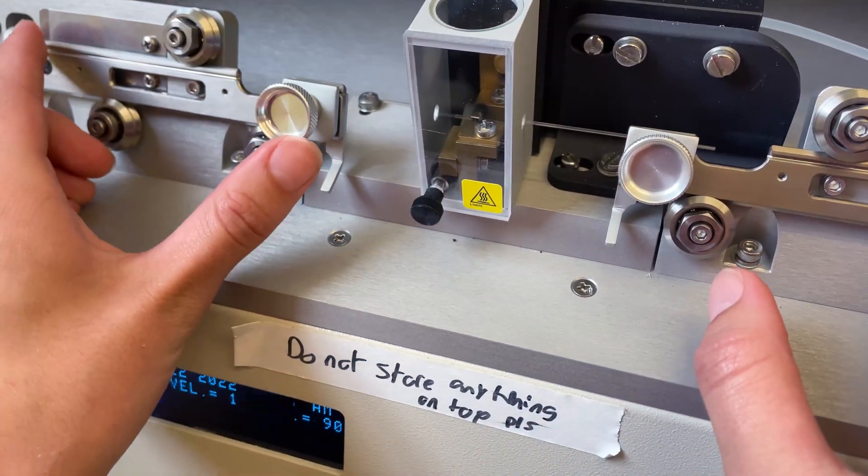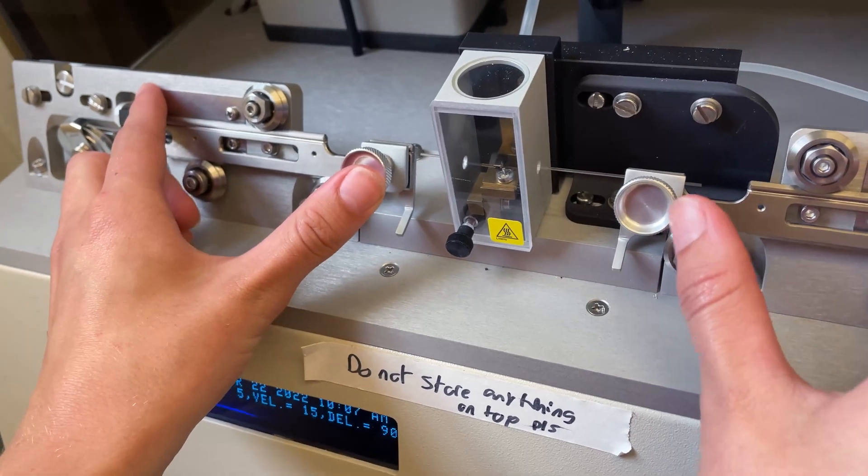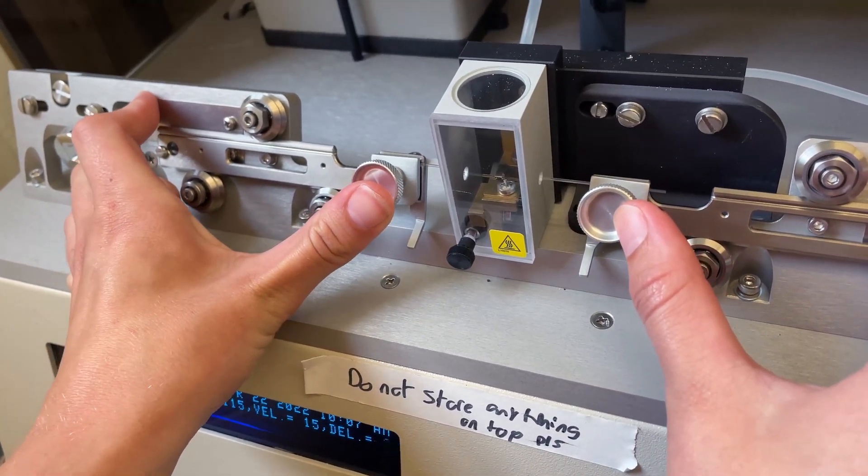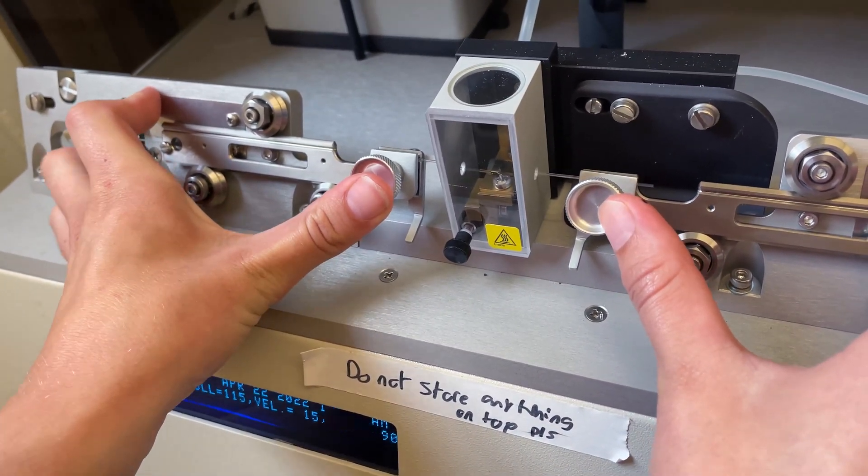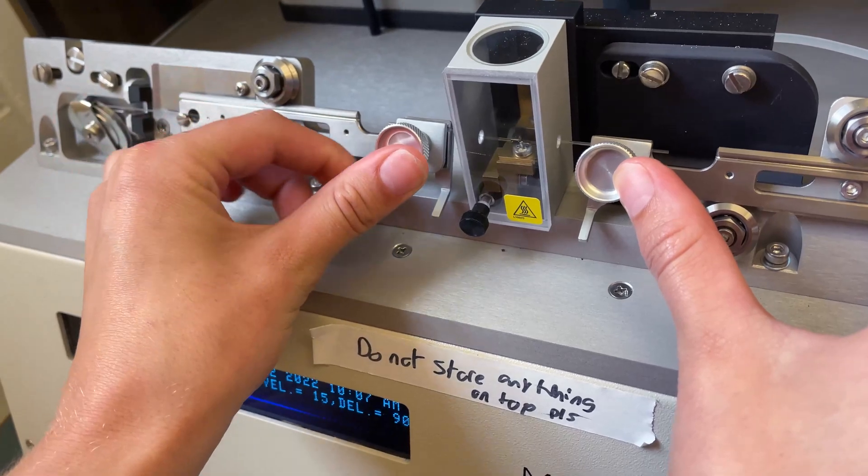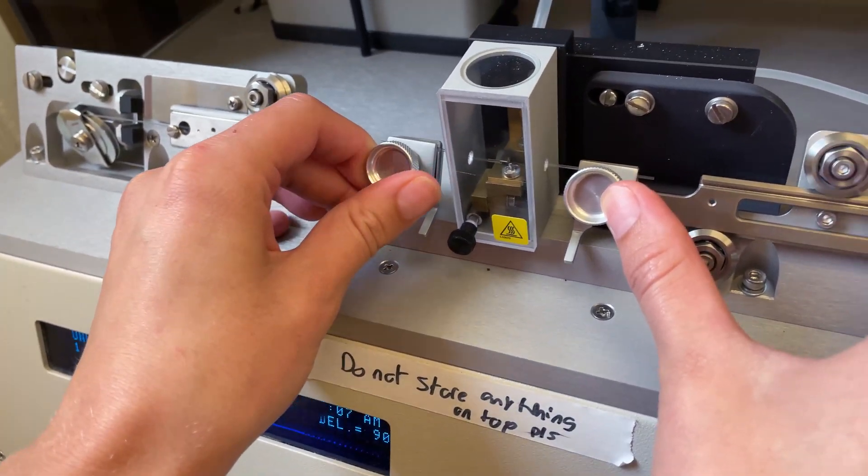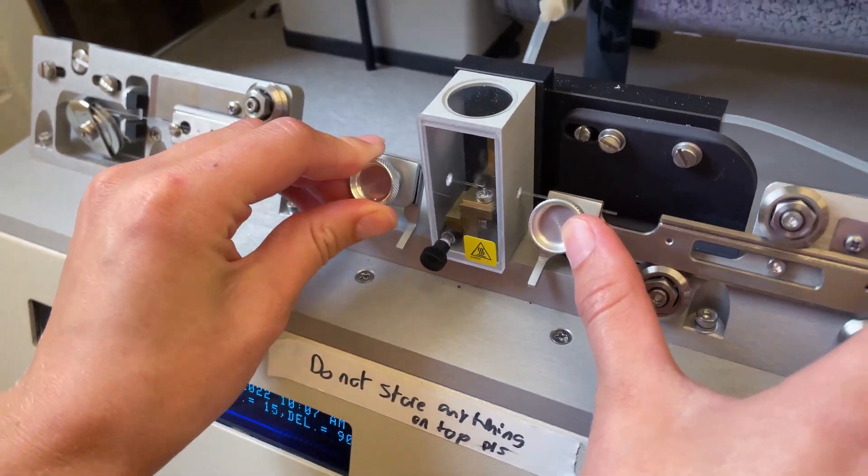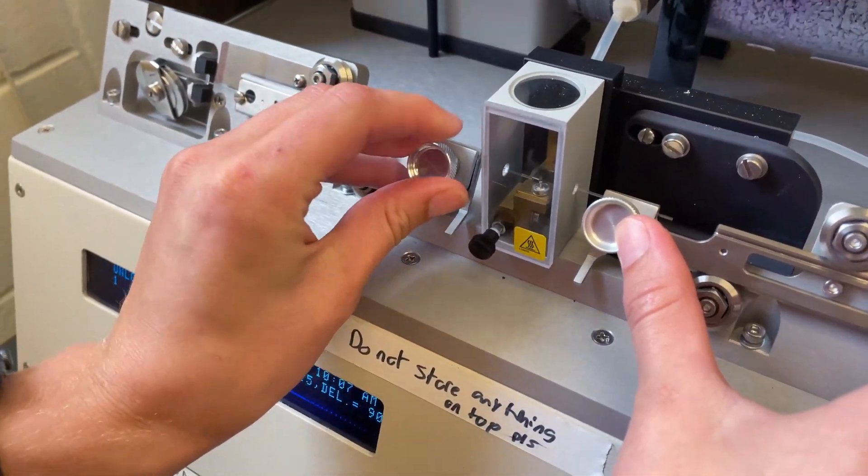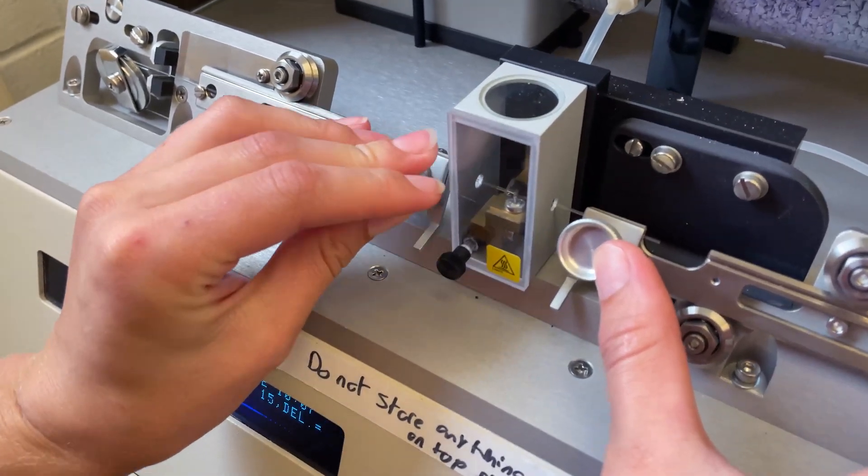I'm going to push this metal piece down to pull the other clamp towards it and we want it to be centered. We do quarter of an inch over there, just pull it up.